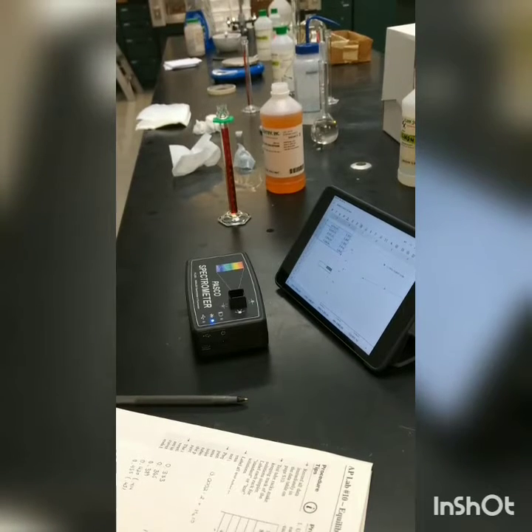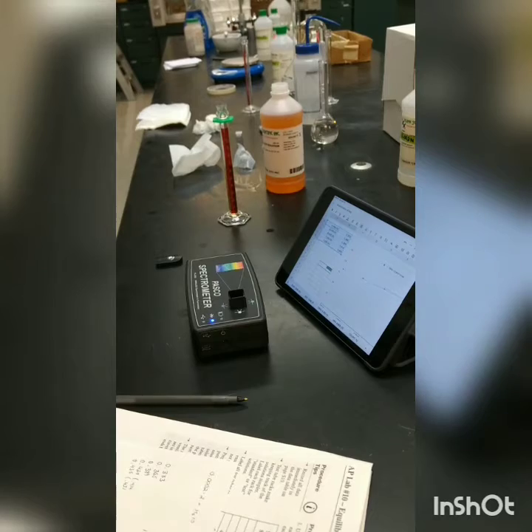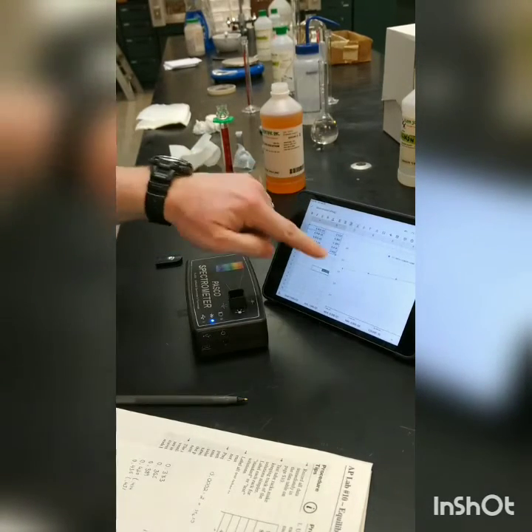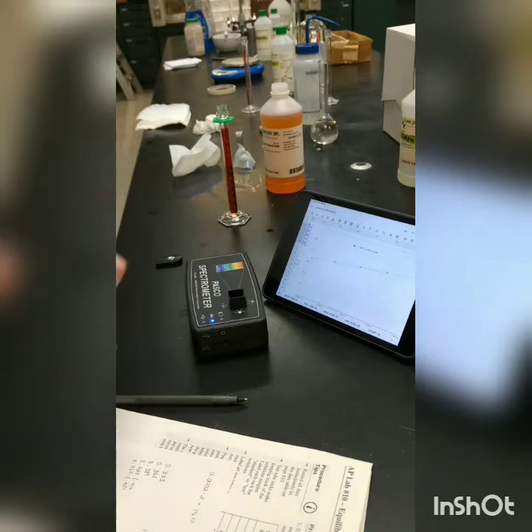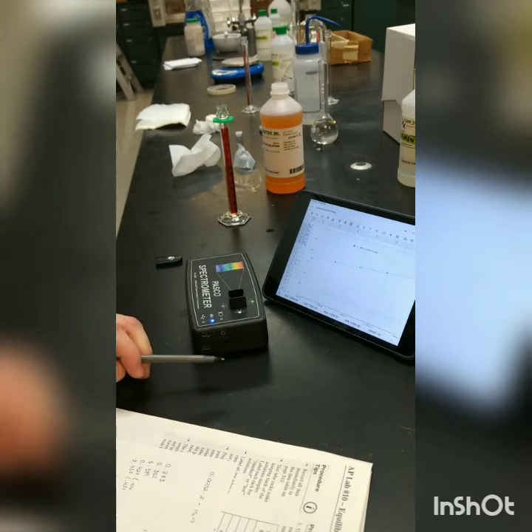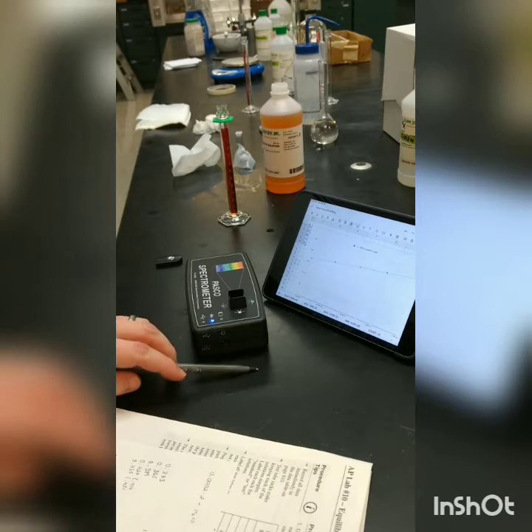All right, so I finished doing all of the absorbances for the standard set of solutions. I plotted the concentration versus the absorbance and got a nice linear graph with an R-squared of 0.994. And I've got an equation there that doesn't seem to go through 0, but I'm going to use that equation ultimately to use the absorbance to calculate the concentration in part 2 of the lab.